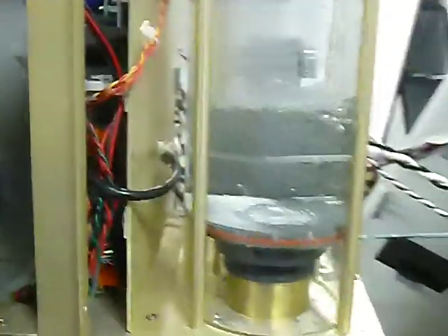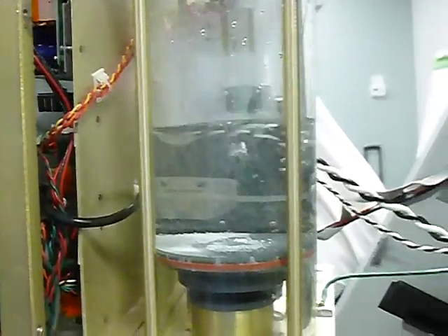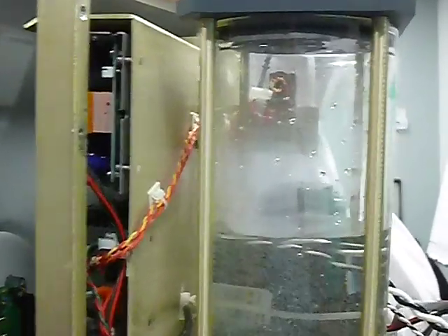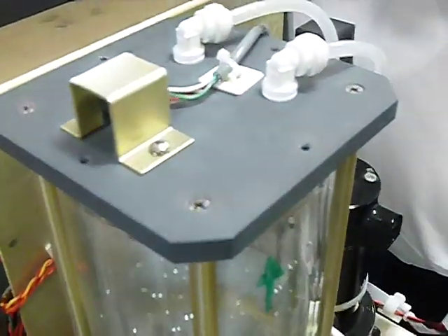Look here, the delay, see why the delay. One could be the temperature, the other one is the pressure. I can see it creating suction. Way to start creating pressure. Now it's creating pressure. Yeah. It's going up.